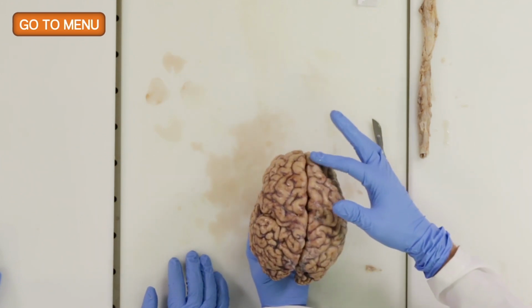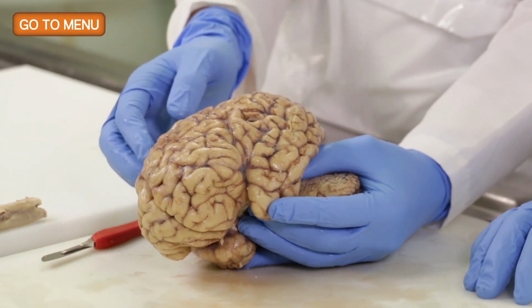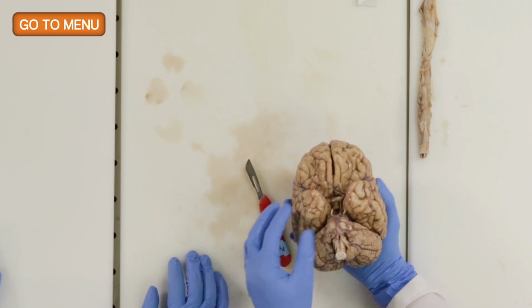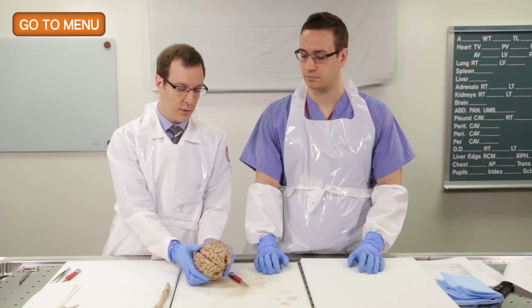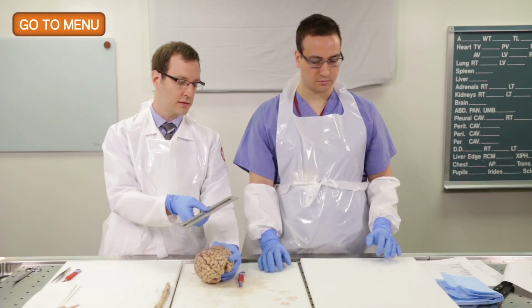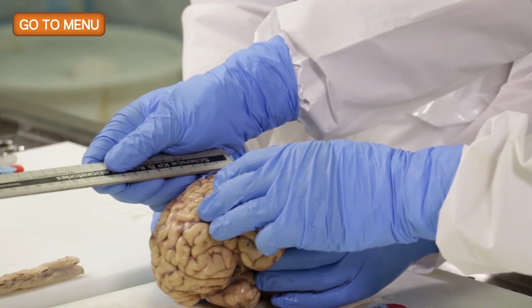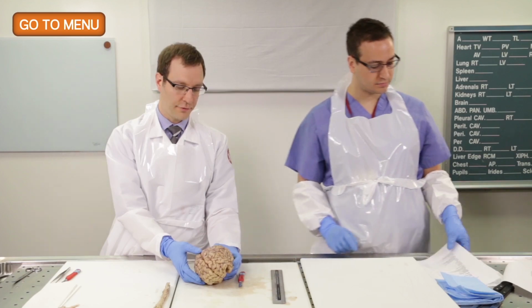Again, the medial aspect of the brain will be supplied by the anterior circulation, and your middle cerebral arteries, which we can see are starting in this region. Here's the internal carotid. The middle cerebral artery will go along the Sylvian fissure and then send branches along this distribution. So we want to measure this grossly from the exterior surface to have an idea of how big this infarction is, or likely infarction. So medial to lateral is approximately 6.5 by 1.1 centimeters. And so then the other dimension we'll record after we cut through the brain.